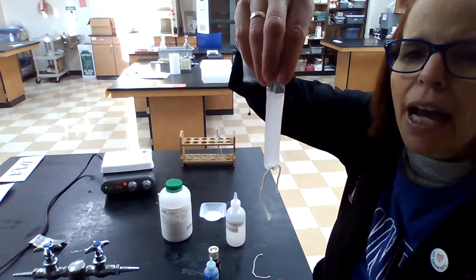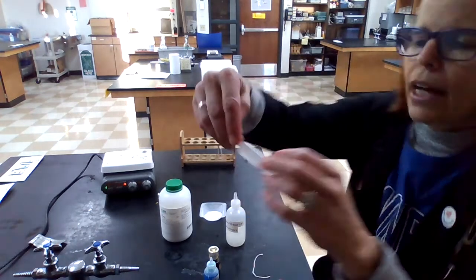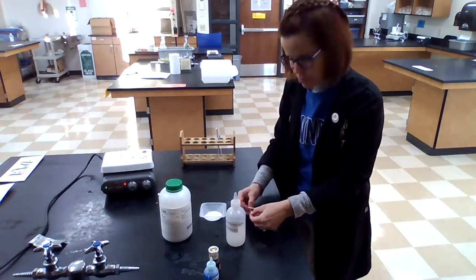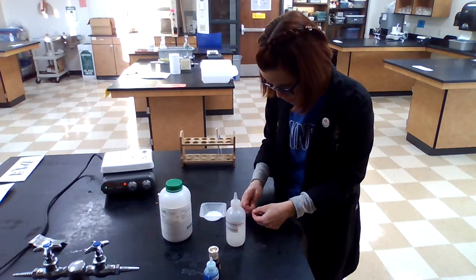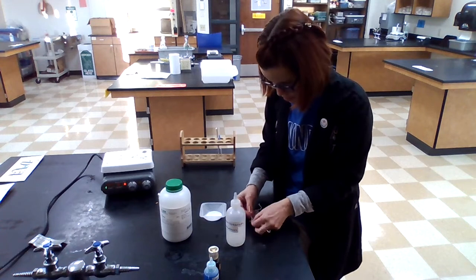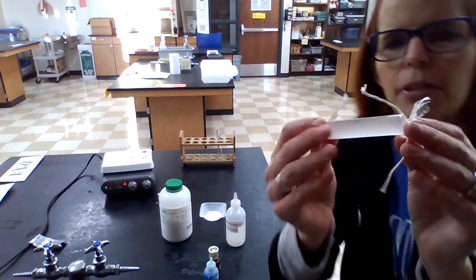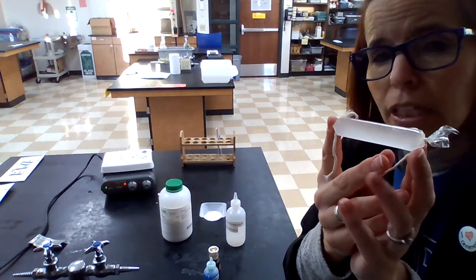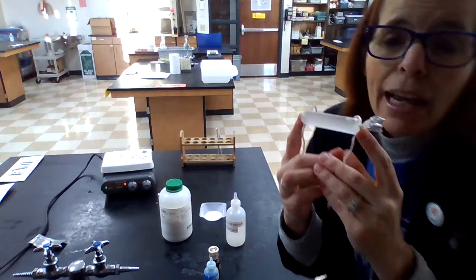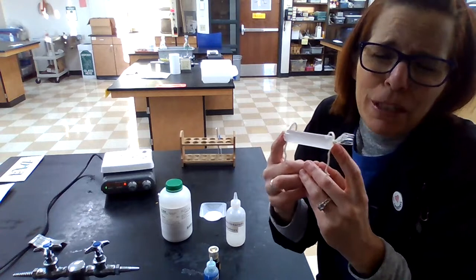Here's my semi-permeable membrane. I added sugar and starch, but I can't see which one is bigger or smaller. So I'm going to twist this up, make it really nice and tight like a hot dog shape. The only way anything can escape from this tightly sealed bag is to come out through the pores. I'm going to assume only the small thing can come out and the big thing cannot. It's possible they both come out or both get stuck — then we'd be back to square one and wouldn't know which was bigger.